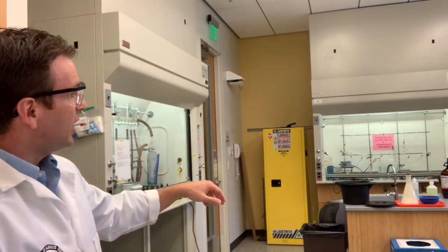Once this is all cooled down, I can clean all the glassware just by rinsing with some acetone into the organic waste. Also, in your experiment, you would check the effectiveness of the separation using gas chromatography to see how much of each component is in each of the fractions. But this is being recorded during the COVID crisis. The GCs are not up and running right now, so we will skip that as part of this video.